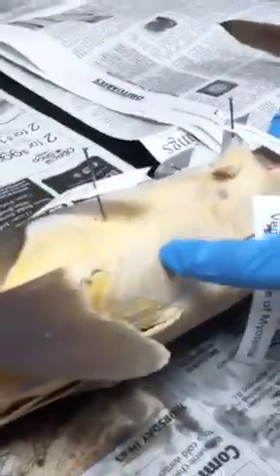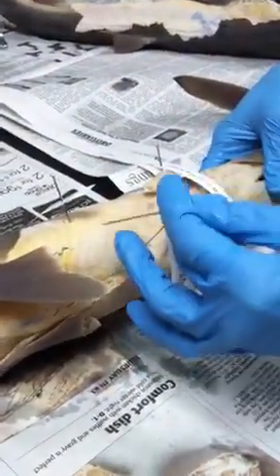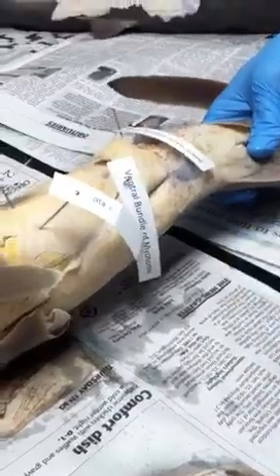If you look really closely, you can see that there are white lines separating each of the muscles, and those are referred to as myosepta — septa separates. I look right here and I can pin it here. I can also pin the white lines up here too. I went ahead and pinned that myosepta, so then this part is done.